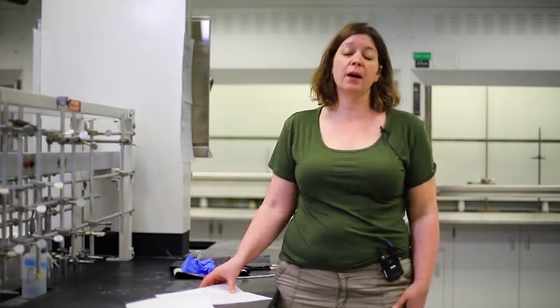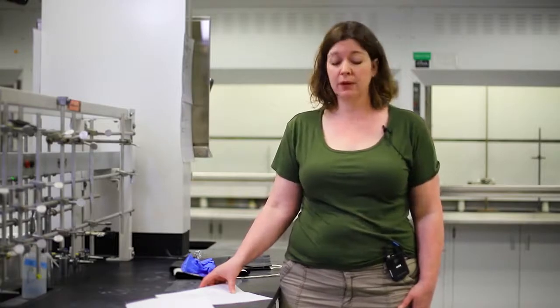You're not going to do anything like this during the semester. Your lab kit doesn't include these materials. But we do want you to be aware of what could happen if you just randomly mix things together, or worst case scenario, what could happen if you have things that are flammable or combustible or corrosive. So one of the first demonstrations that we're going to do will show you the effects of corrosive material, of acids and bases on a protein.